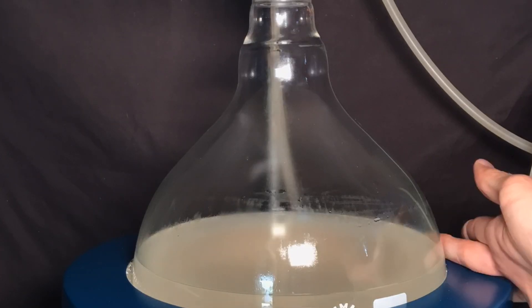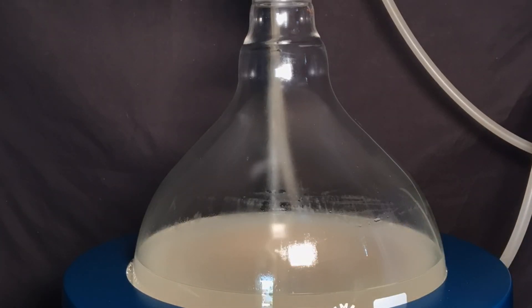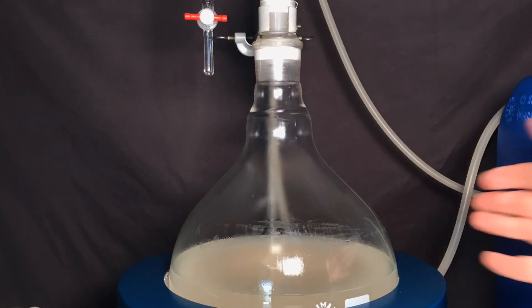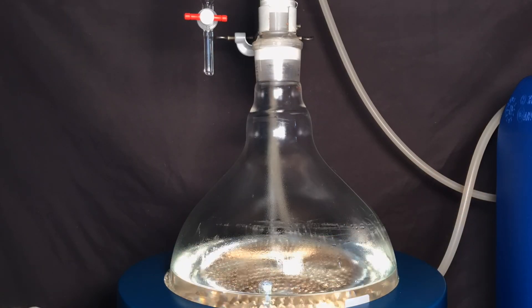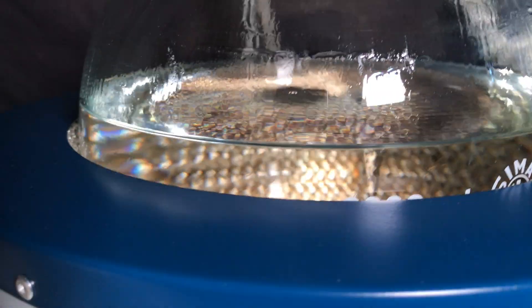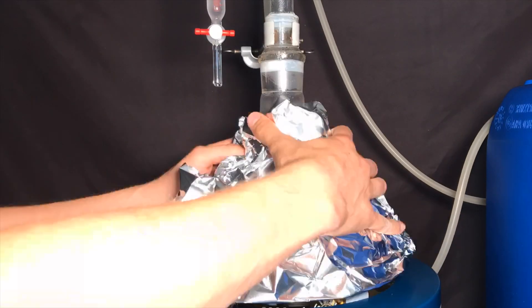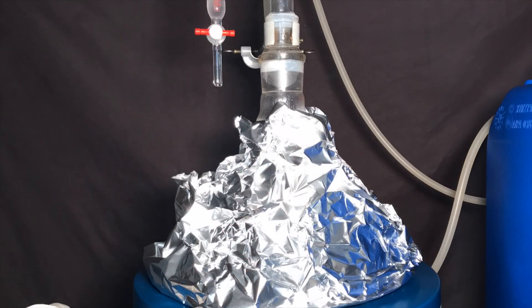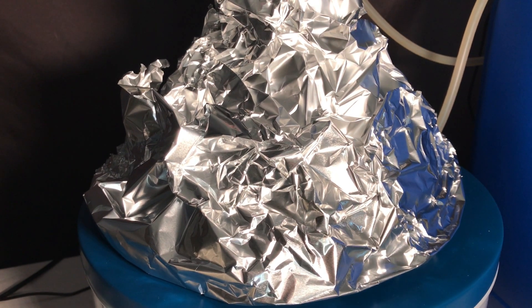I turned on the heating mantle and as it heated up we were able to observe this nice effect. The liquids which were now hot enough dissolved in each other and formed a clear solution. We heated for even longer and you finally were able to see it boil. In order to increase the efficiency by minimizing the heat loss, the flask was wrapped in aluminum foil.